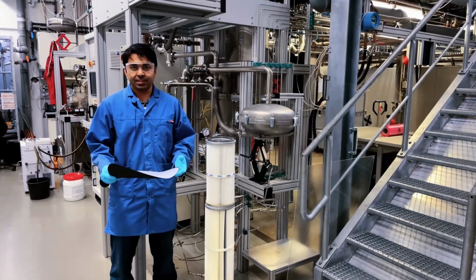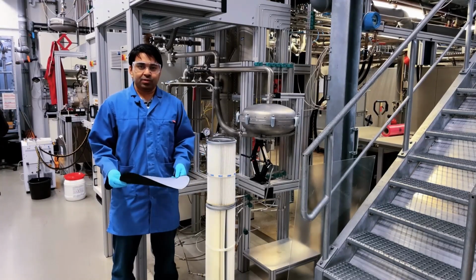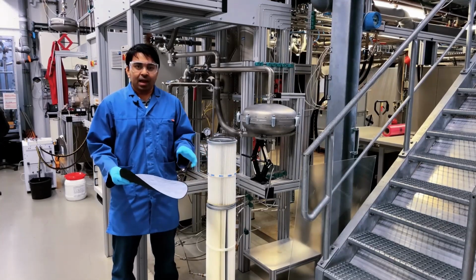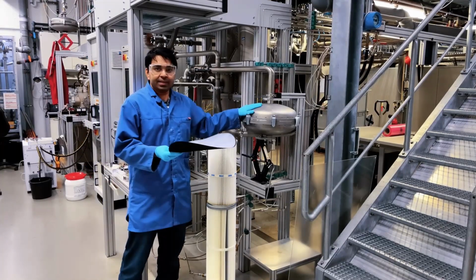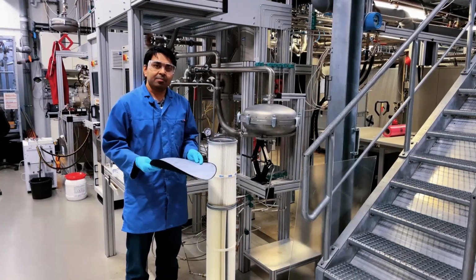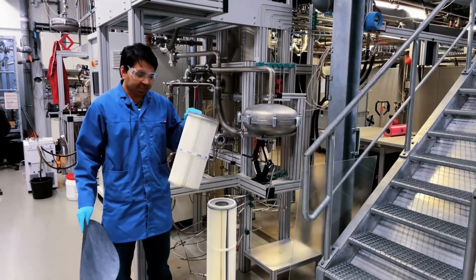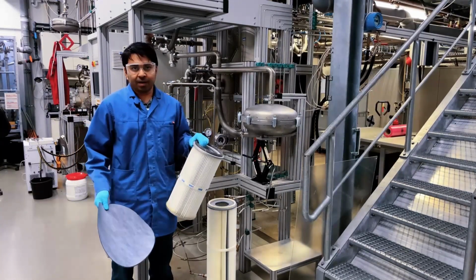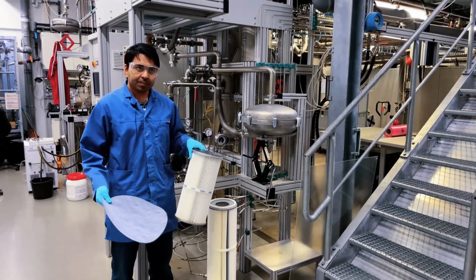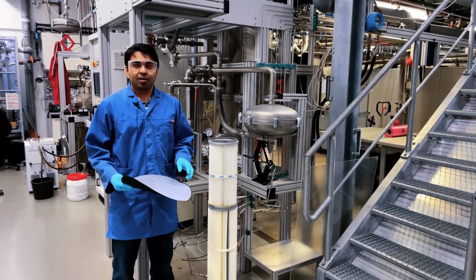You must have noticed that this reactor can be upgraded to industrialized size, and everything can be automated. However, as you can see, we use this bag filter here to get like 1 gram per hour, but we can upgrade this one to get bigger filters to get up to 1 kilogram per hour, and it can be improved further. Now I transfer to my colleague Moritz for the hot wall reactor.